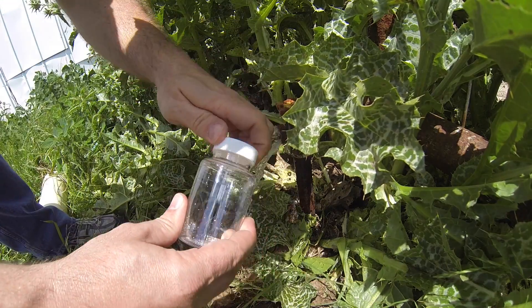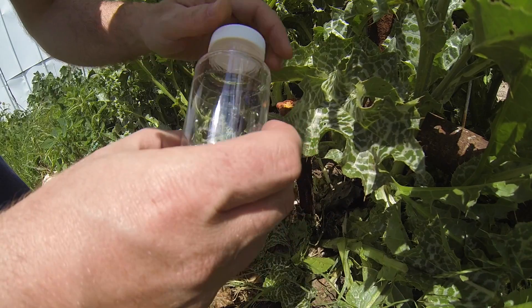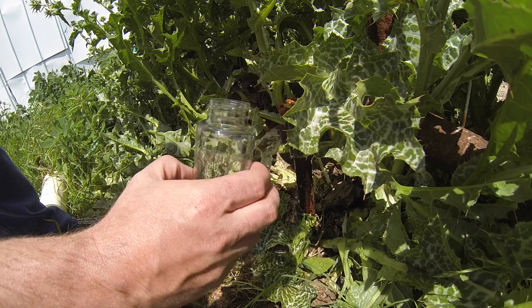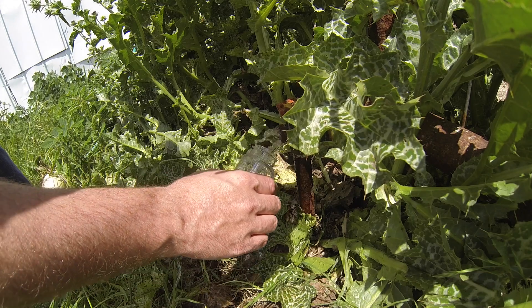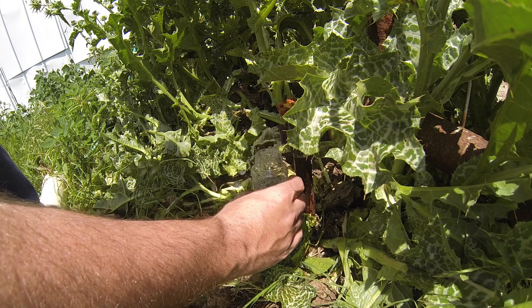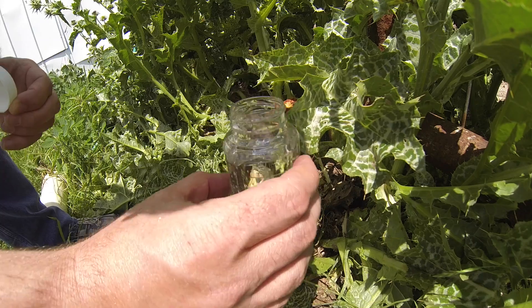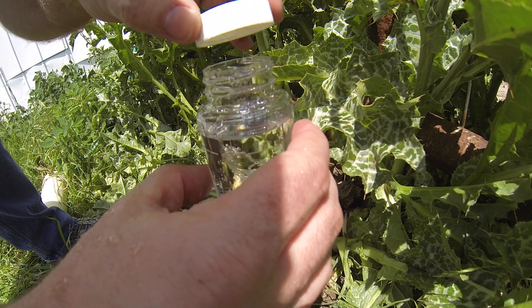I'm going to just open it. There are little pellets inside. They say not to take those out or rinse it out or anything. Just fill it with water to the 120 milliliter mark. I'm going to try to fill it up to there. It says don't overfill. Don't allow the water to get on the outside. It's about 120 milliliters — a little bit too full, but that's just about perfect.